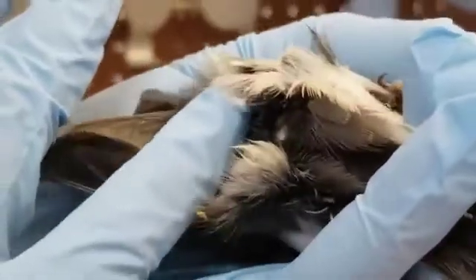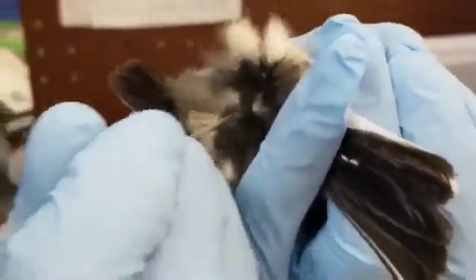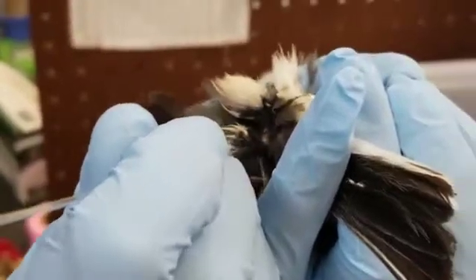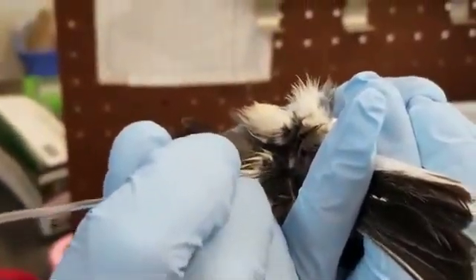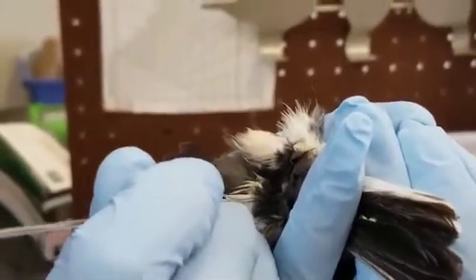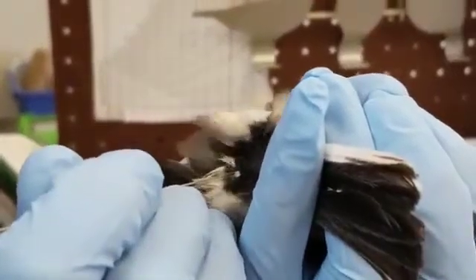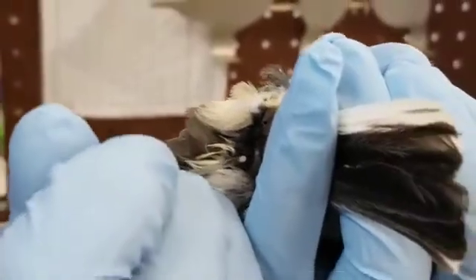The white part is the tip where the oil comes out. We're going to take our capillary tube and just very gently, as if you are stimulating it with your beak like a bird trying to get preen oil out. Very gently, and the capillary action of the tube will take it into the tube.